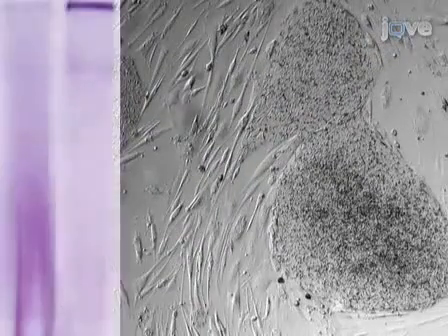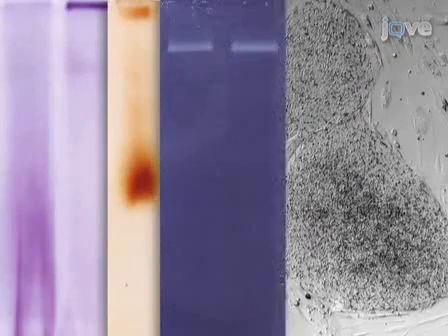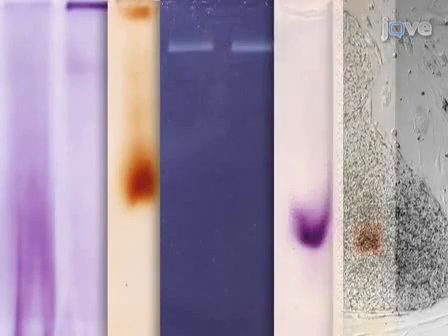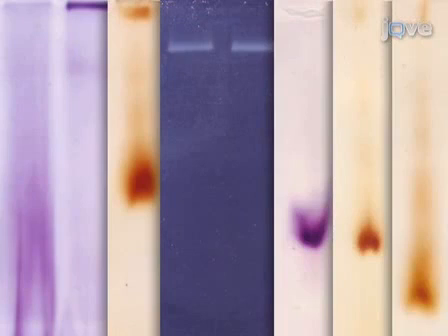In this video, we will show you how the mitochondrial respiratory chain complexes of human embryonic stem cells can be analyzed using in-gel activity assays.